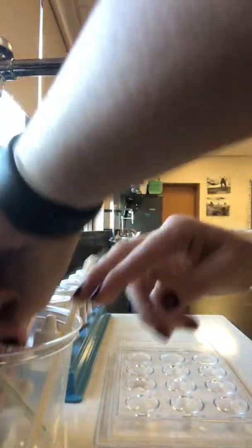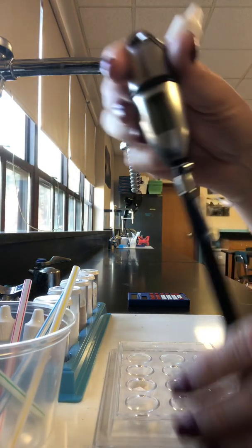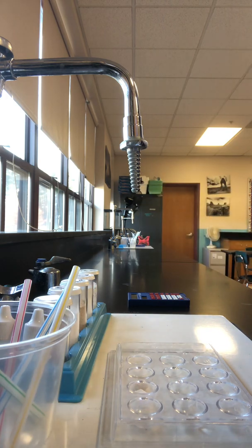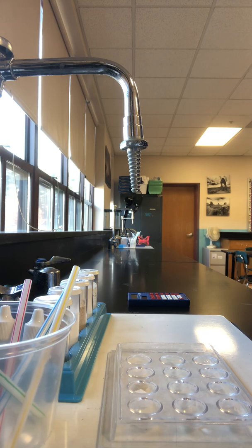Okay, and for the first 2 spots, I'm going to do 10 drops of water. As I do the 10 drops, I'm going to have Ms. Schaaf here take a measurement on our kitchen thermometer temperature probe. She's going to take a sample of what it is before, and then she's going to turn it towards the camera to see what it is after.